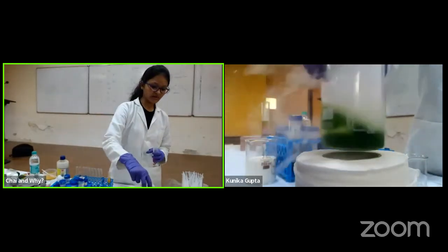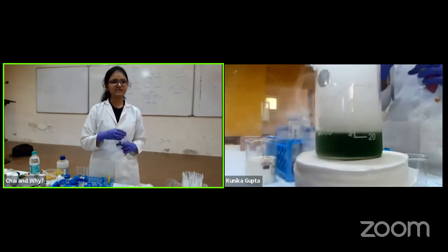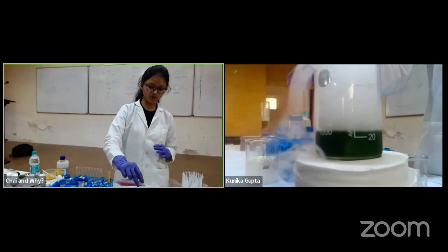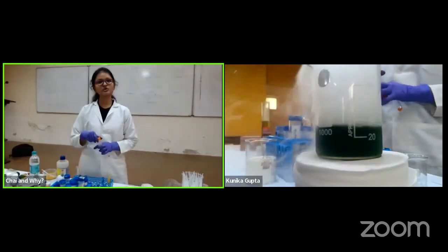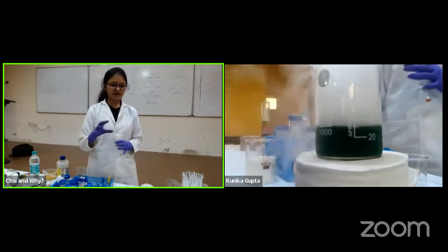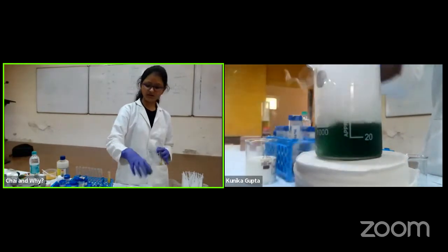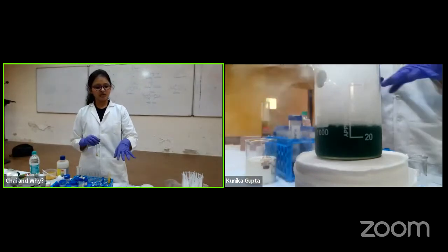So I first tell them that dry carbon dioxide is not working. Because I have already told you that carbon dioxide is a weak acid, right? So it gives less number of protons, but the base that I have used is actually a strong base, that is sodium hydroxide. So that is why it is taking a bit of time to react, and if it doesn't, then add a drop of acid. I'll add a drop of acid. Okay. But let it be. We'll do some other experiment.